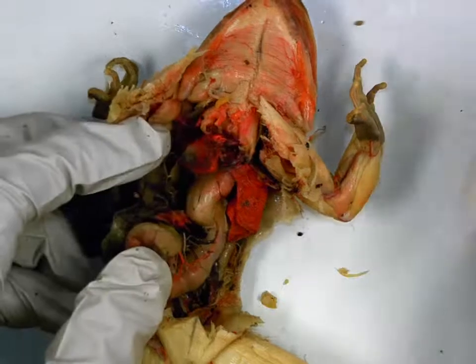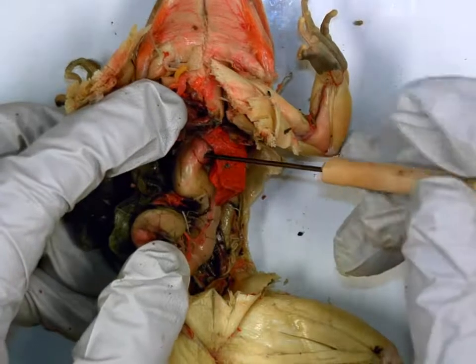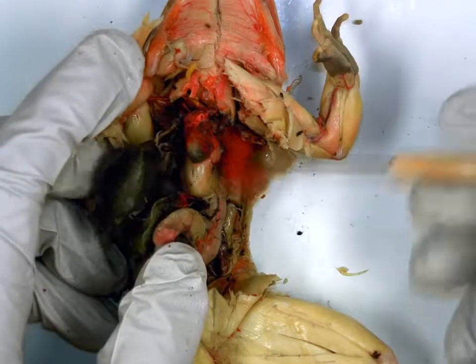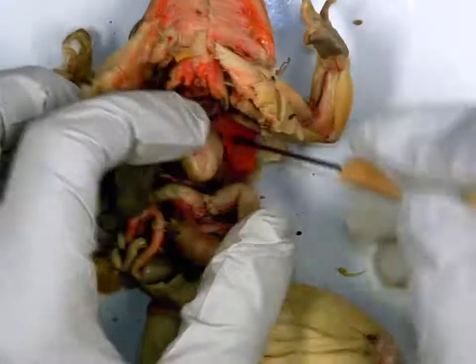All right, if you rotate everything over, what is this big tube coming from the throat region? Still the esophagus. Function? Passageway for food. Sitting next to the esophagus is this deflated pouch. There's one on both sides. The lungs. Function?